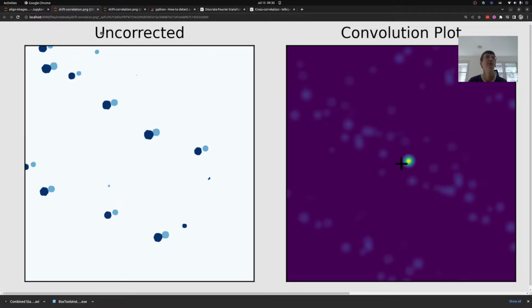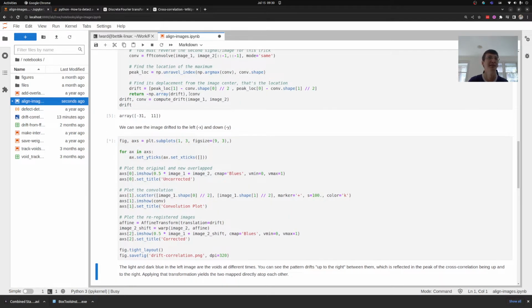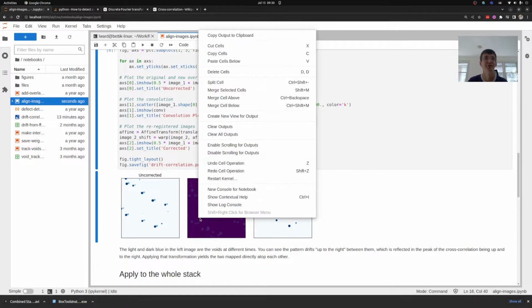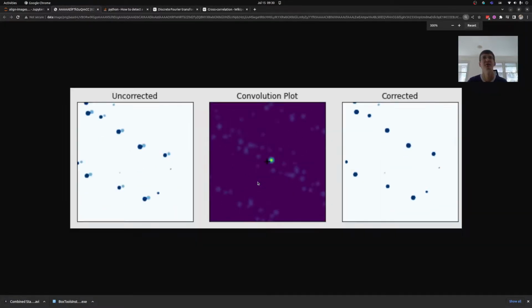Let's open this image in a new tab. All right, let's run it. I didn't rehearse this. All right, let's open you in a new tab. Perfect. So if you take a look here, here are my two images. See how there's that left and downwards drift.